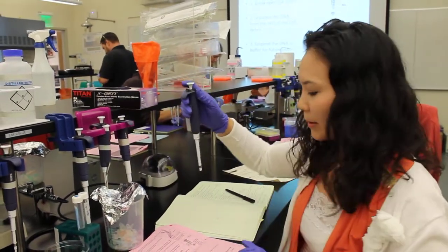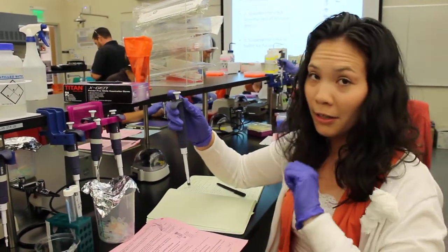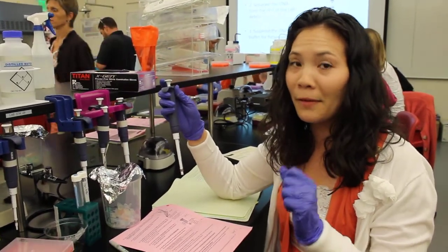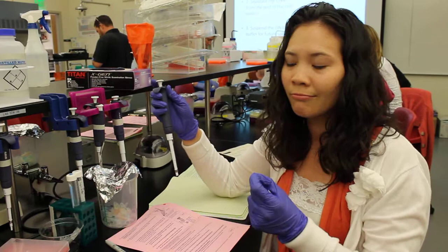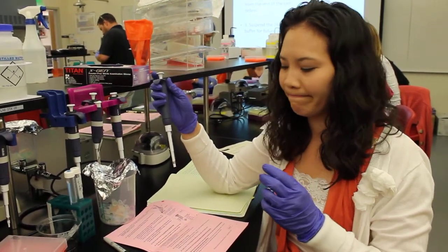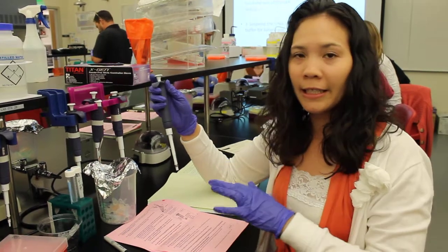What we're doing is extracting DNA. We extracted DNA from what appeared to be maybe a fish fin, and then something else that also smelled a little fishy.